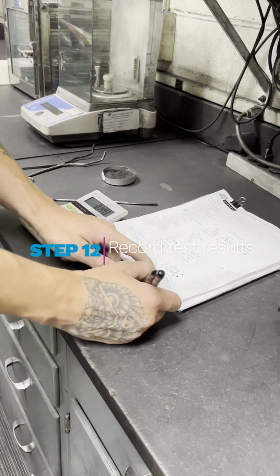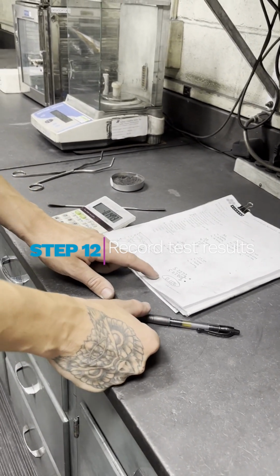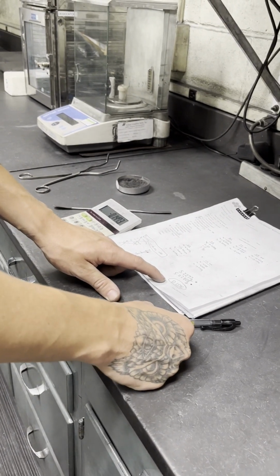This is very low. This is because this is synthetic graphite. So it's already been graphitized at a very high temperature. That means it has very low volatile matter.